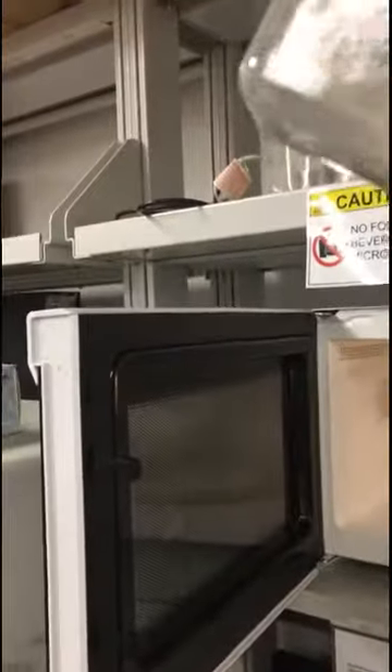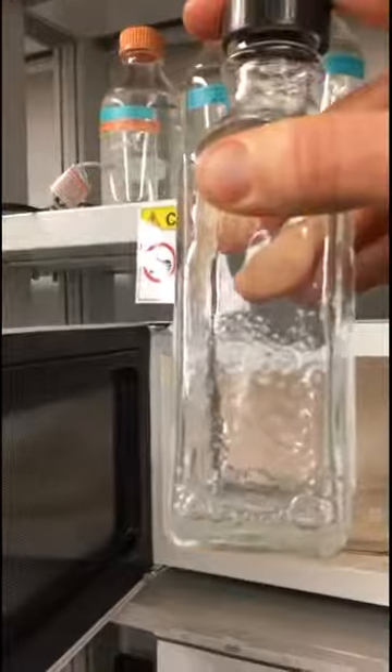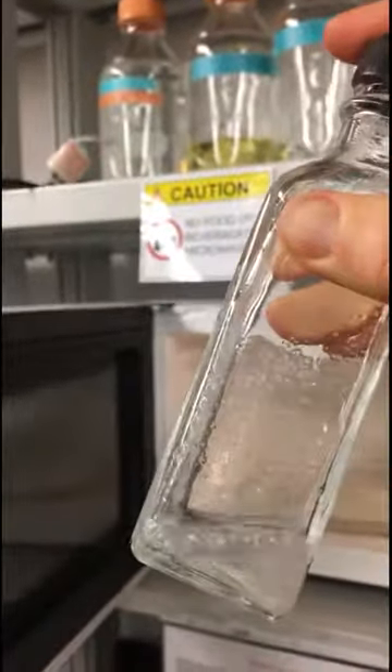Starting it up again — I think it's beginning to bubble. It was bubbling just a minute ago. I want to heat it up until I get all these little pieces of unmolten agar liquid.